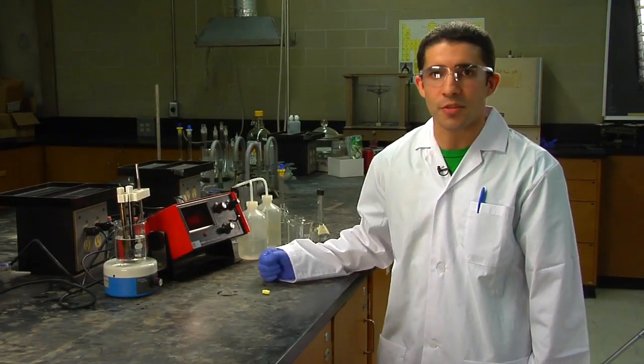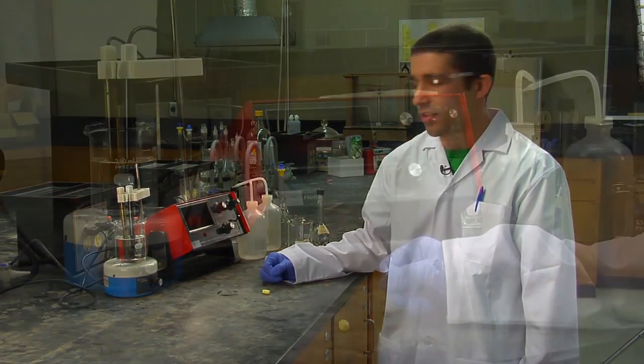Hi, my name is Mark, and I'm going to be demonstrating how to use the ion selective electrode.